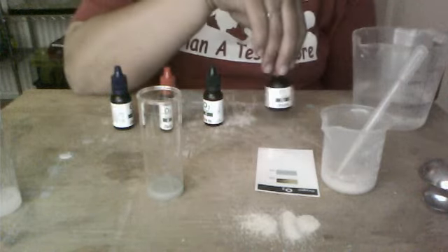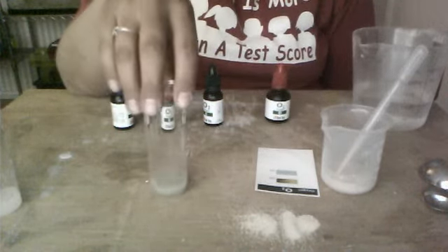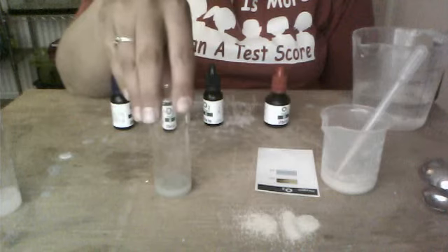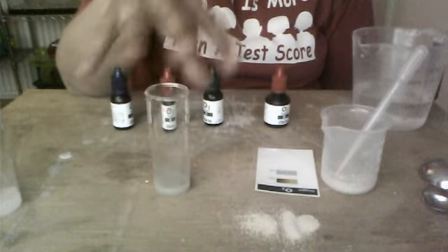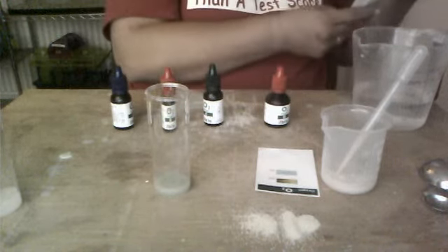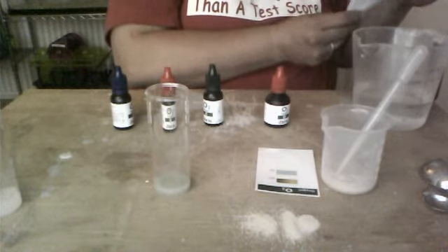Now the purpose of reagent D is to remove the oxygen from the water totally. So if it turned blue before I added reagent D, that means there was no oxygen left in here. And that's what happened in my experiment. This may be a little bit different for your experiment. You'll be able to answer question 3 on your own and question 5.